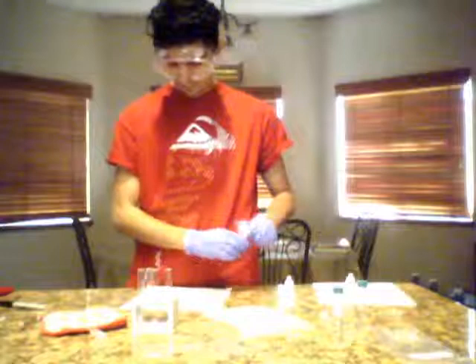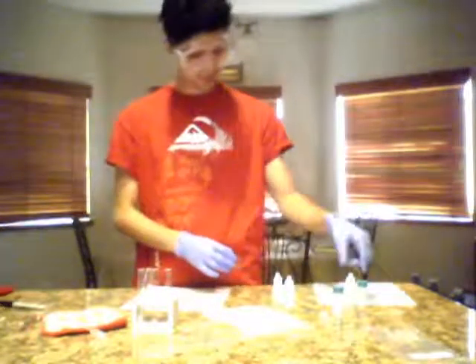And then we're going to add 5 drops of isoamyl alcohol into test tube number 6.